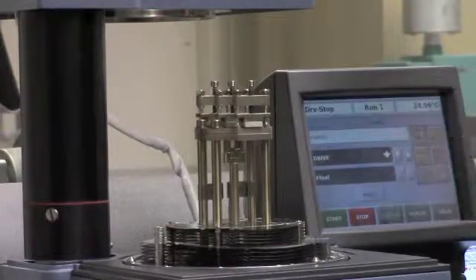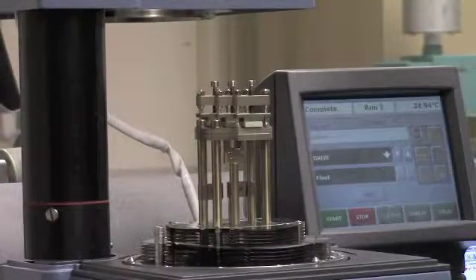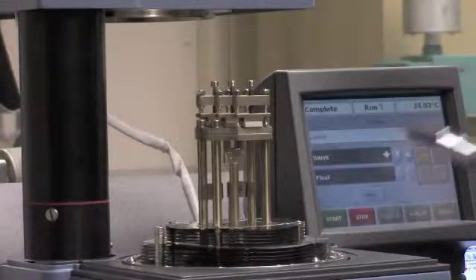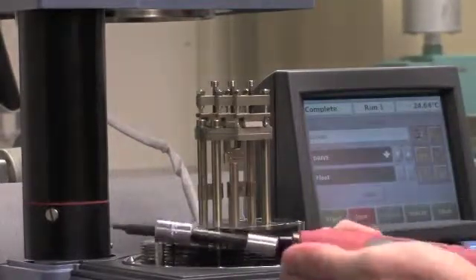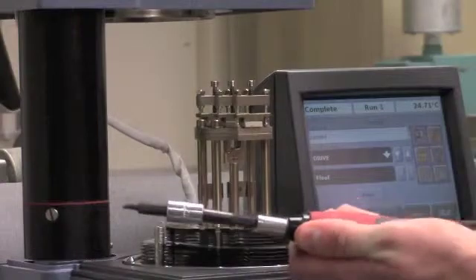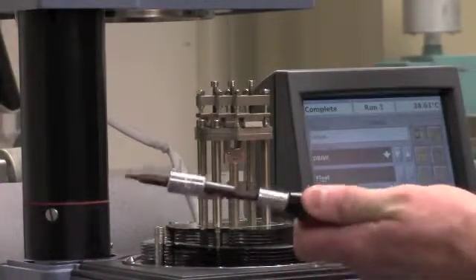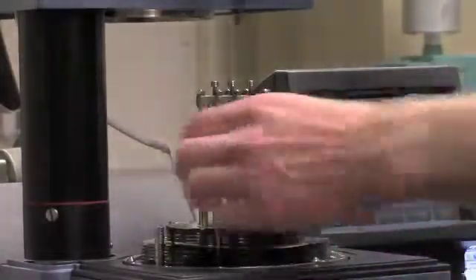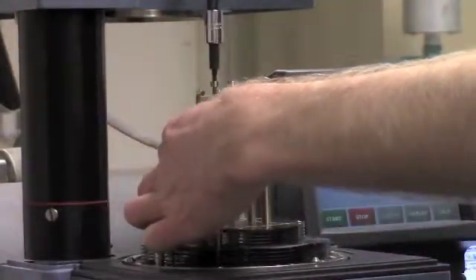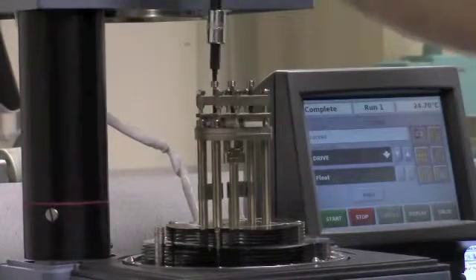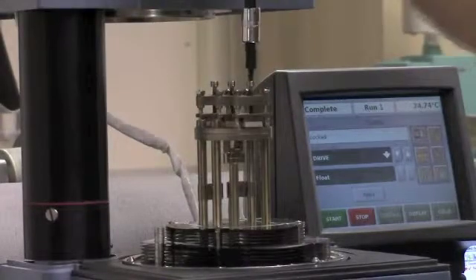Next, lock out the air bearing and use the torque wrench to finish tightening the screws. The appropriate torque for several different materials is listed inside the DMA manual. The torque is adjusted by tightening or loosening the cap at the bottom of the tool. Always make sure to tighten all three screws on the clamp before starting an experiment.